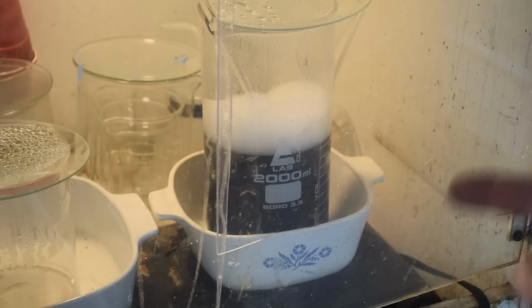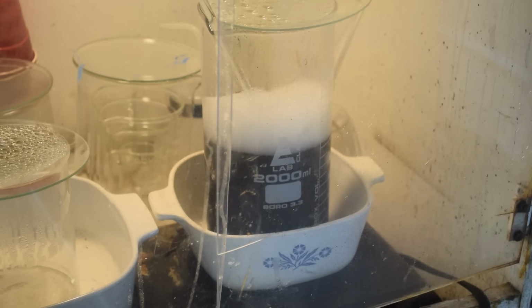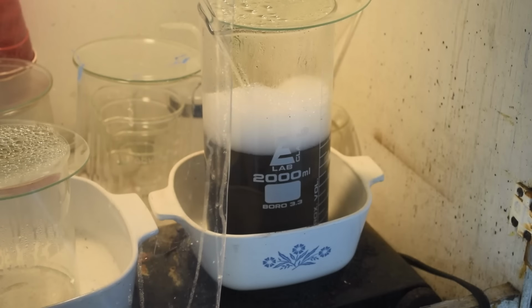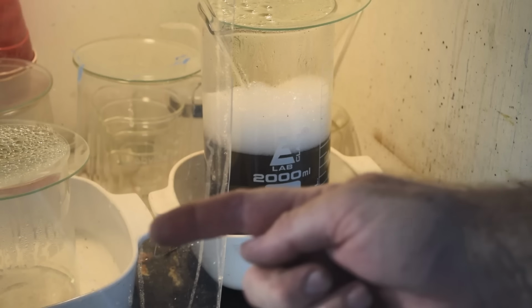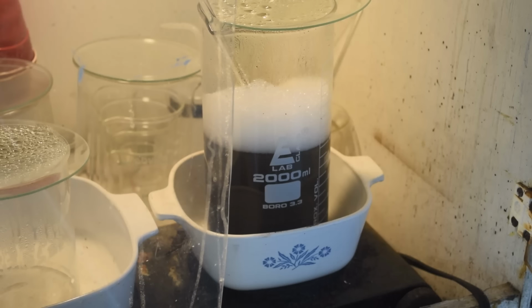All right. This stuff's been sitting here boiling for 20-25 minutes now. Not really seeing much of a change other than the foam's trying to build up to where it's going to boil over here soon. The liquid does seem a little clearer, but that might just be by virtue of having diluted it with a bunch more of this stuff. It might not have actually reduced whatever particulates are in it.